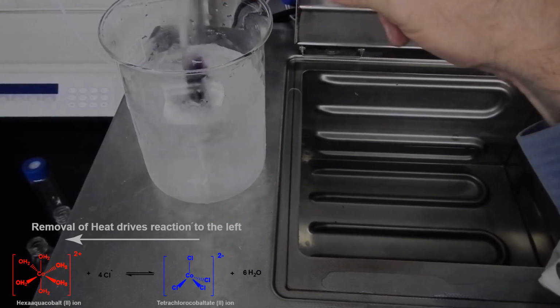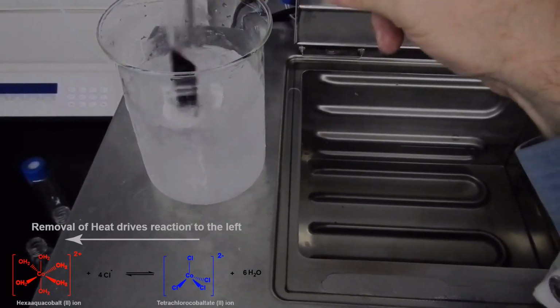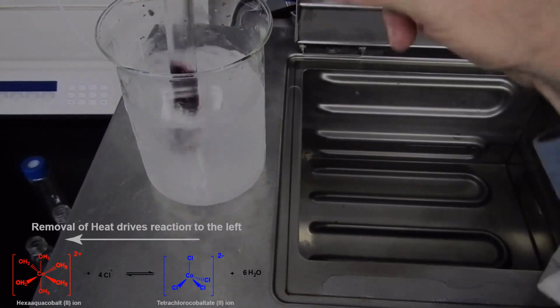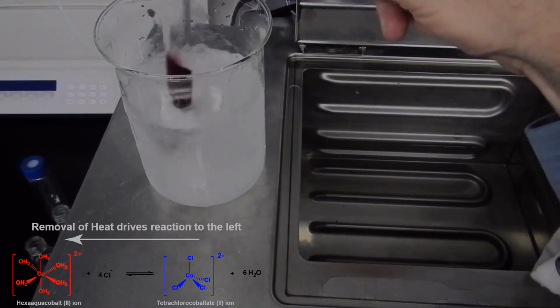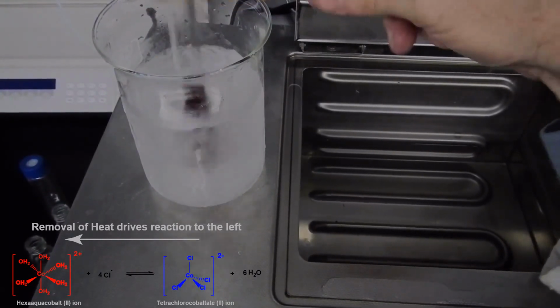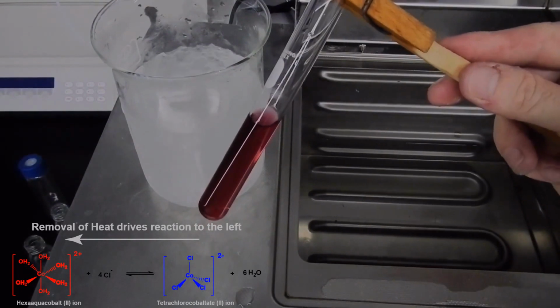So you can see that as the solution cools down, it changes back to this purpley red color, and then finally it'll turn to our pink color. And we can see that it takes longer to actually cool a solution than it does for the reaction to actually occur. But you can see I can change which side of the reaction the reaction proceeds to just by changing the temperature of the reaction. And we can understand this through understanding equilibrium and understanding Le Châtelier's principle. And here's our pink color here.